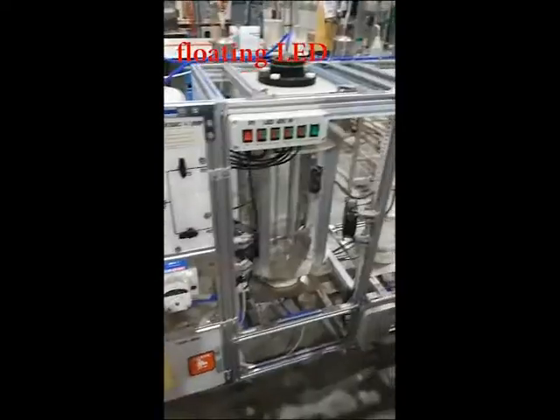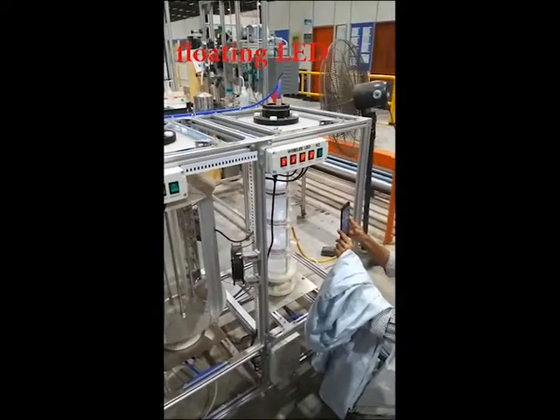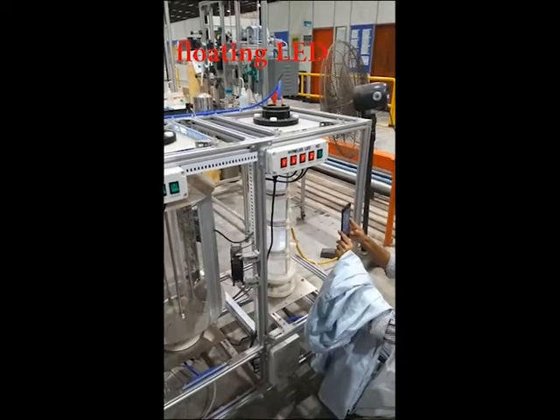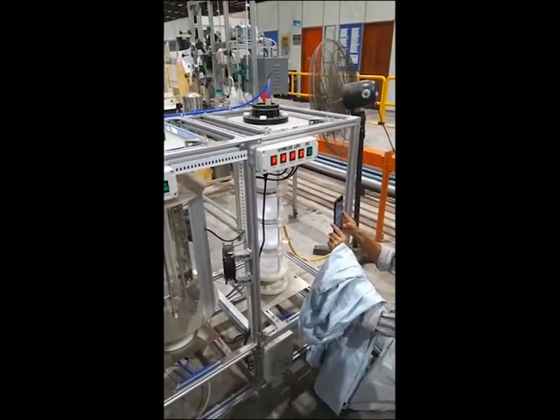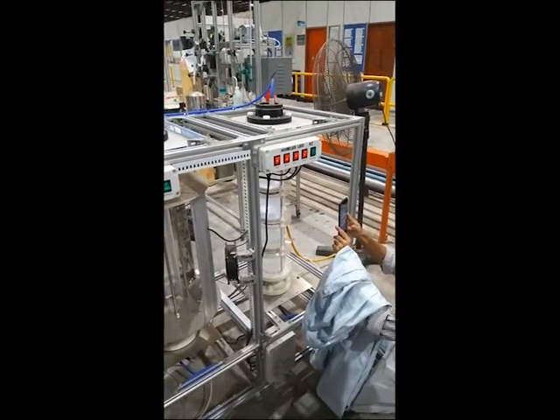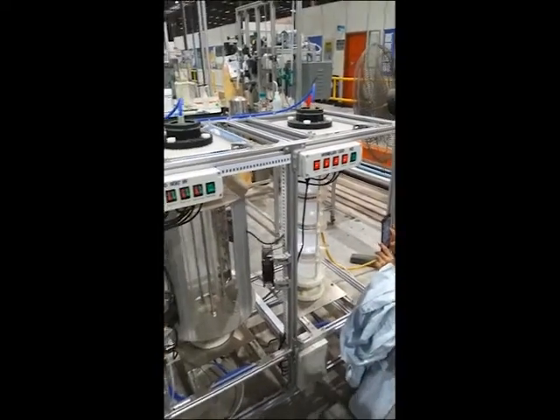To start the LED, you just turn on the lights in sequence, one by one. Give the power first, then turn on light 1, 2, and 3.